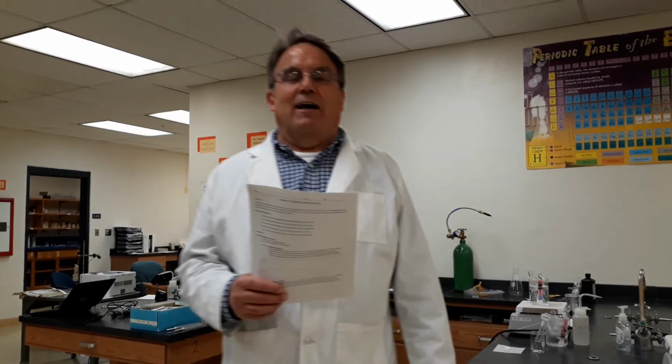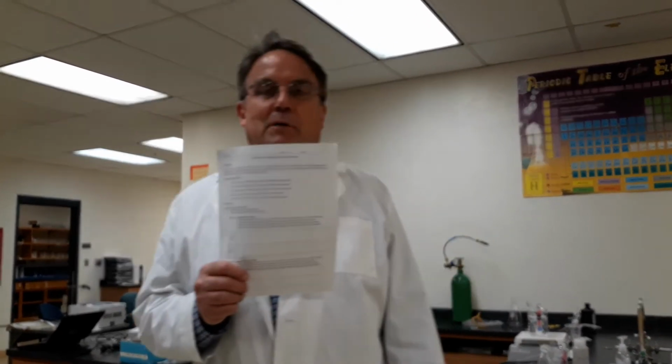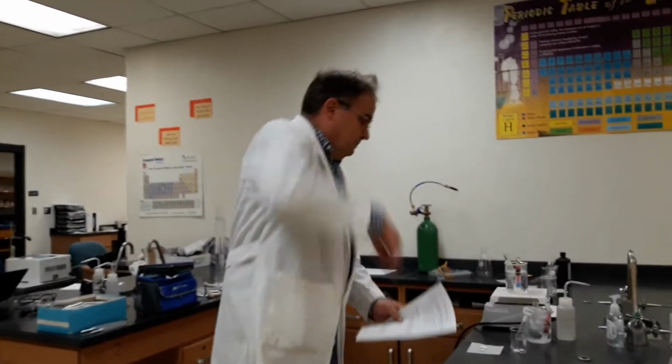All right, today's video lab is the reaction rate lab, where we will look at the effect of several variables on how fast or slow a chemical reaction goes. And from the notes, you should know the four variables that affect reaction rate. So the first section is concentration.